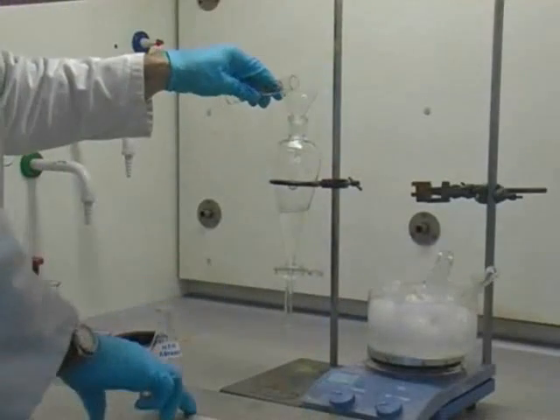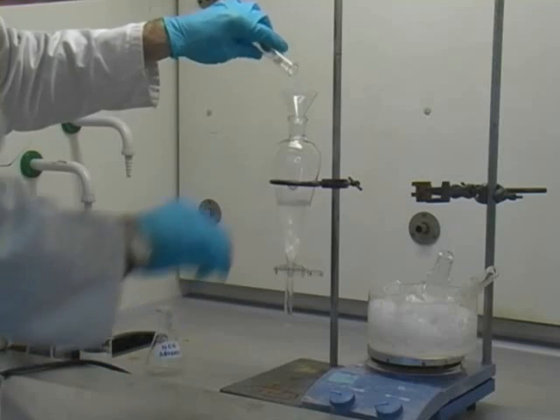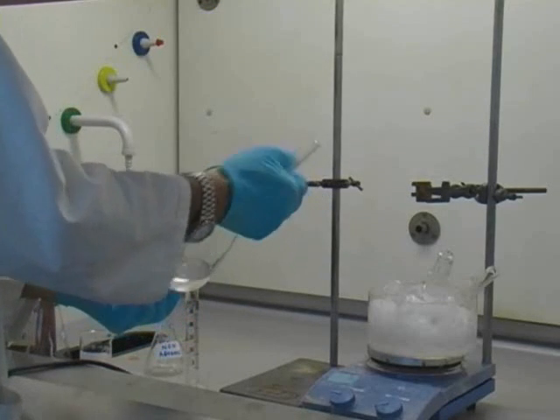Wash the combined organic extracts with saturated sodium bicarbonate solution until no further effervescence is observed.